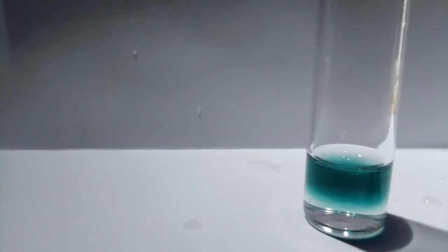I'm looking for a way to separate this dye into powder, which I can add to my organic dye collection. I'm just going to swirl it. Pretty nice. It's a pretty simple reaction I think.